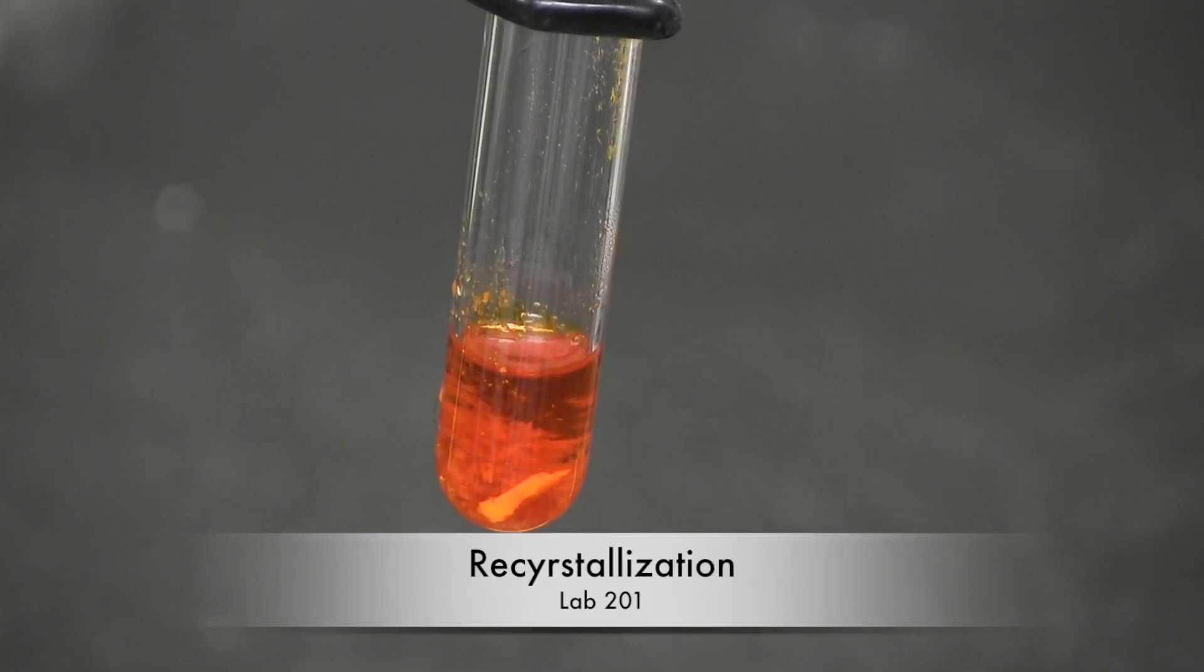In this lab, we will be separating an unknown substance from its contaminant using a method called recrystallization.